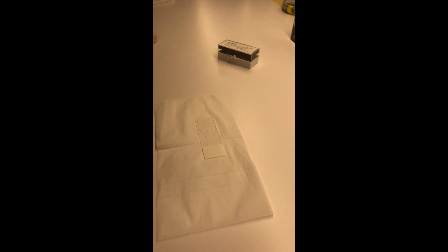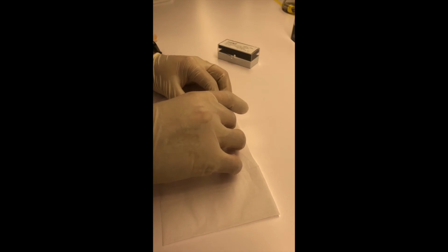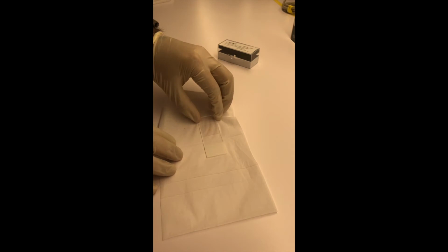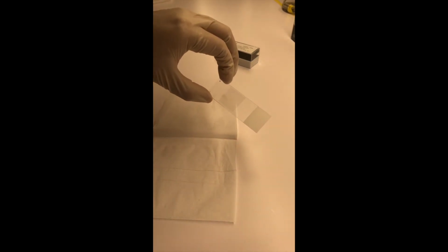So I'd just like to note that I'm essentially going to repeat this process about 6 different times because in my series of samples, there's 6, according to the addition of 0, 0.1, 0.3, 0.5, or 0.7% water. So finally, once the sample's on the slide, I can just cover it up and now it's ready to be imaged. And you see here, there we go. We have a perfectly made slide.